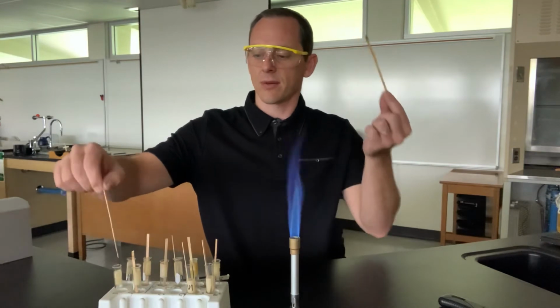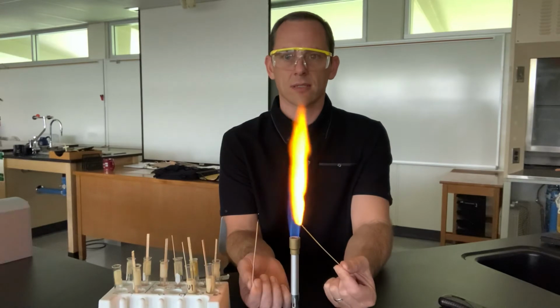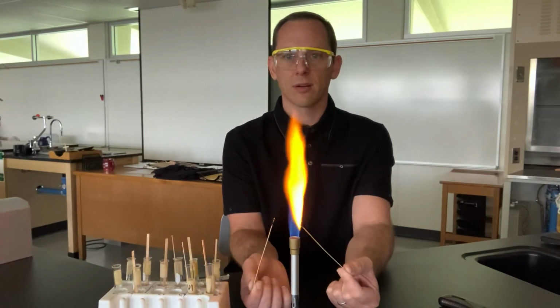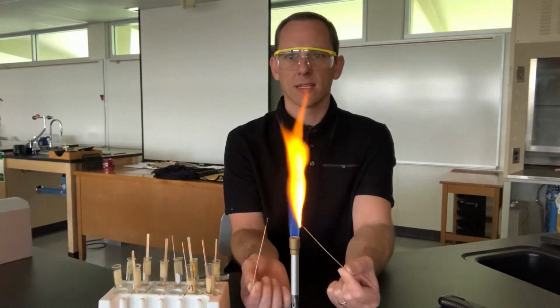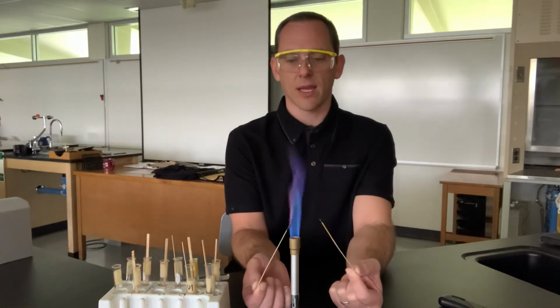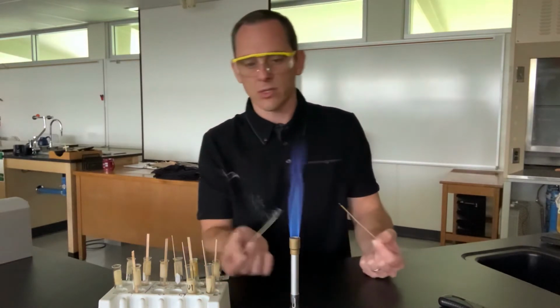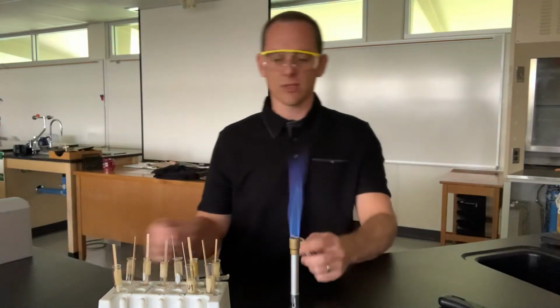So this one's sodium. This one's calcium. See this? That's sodium. And there's calcium. You see the difference? Much brighter, more yellow to it. This one's got a lot more red in it. Okay. Also, the brightness is a huge giveaway. Look at how dark that one is. So they're both yellow or orangey, but one of them is just a lot darker orange. The calcium. I know it's tough, but you do it a few times and you get used to seeing it.